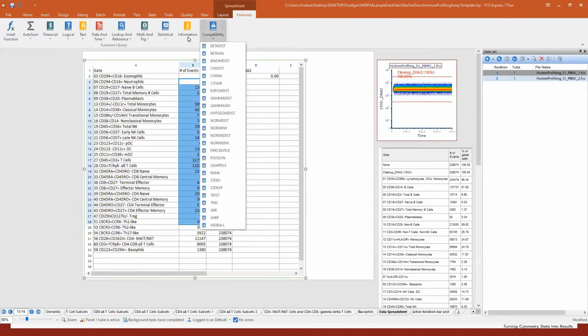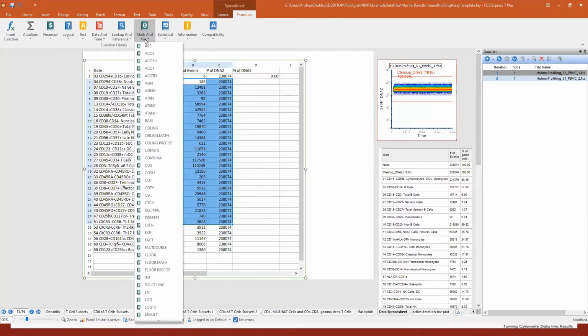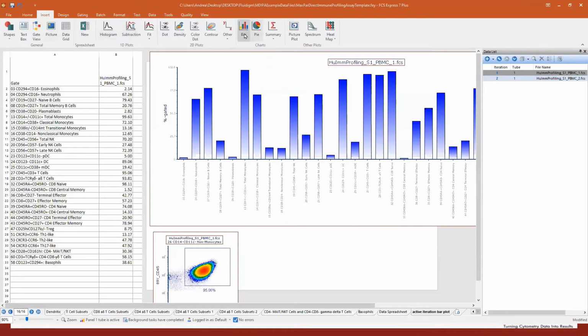You see, we try to be consistent with Excel. You can create statistical formulas. You can create mathematical formulas. So if you want to calculate an ANOVA or t-test, this is FCS Express, data analysis and data reporting. And of course, we have charts. We have many charts available. You see here we have bar, pie, box and whisker, violin plot, beeswarm plots. And in this case, I'm showing you a very simple bar plot.